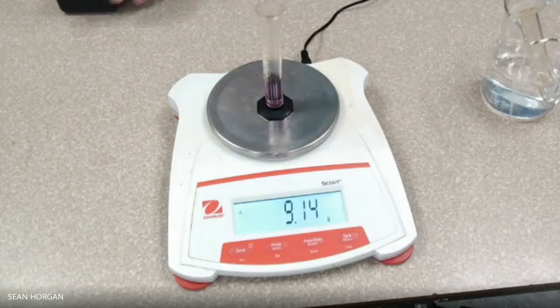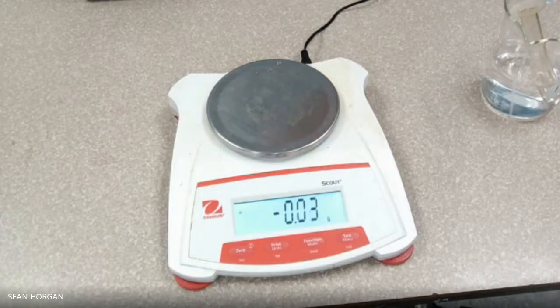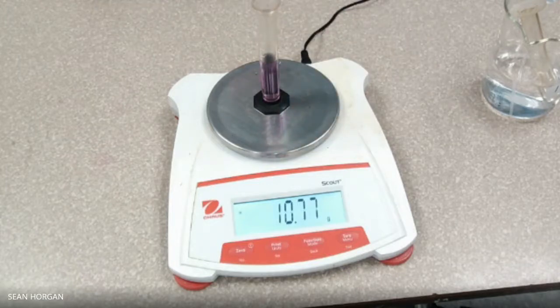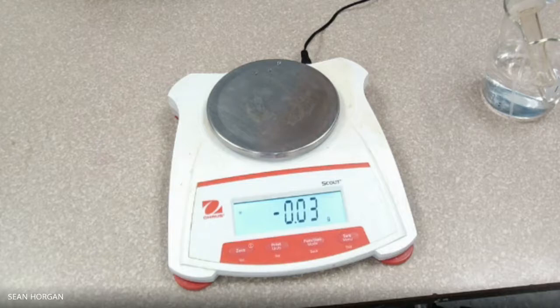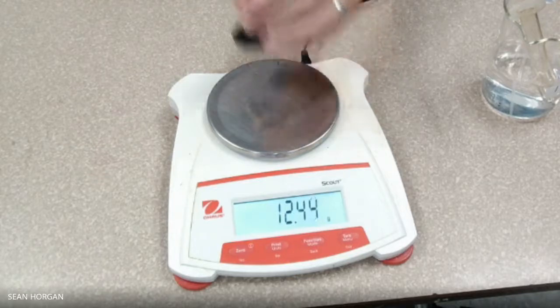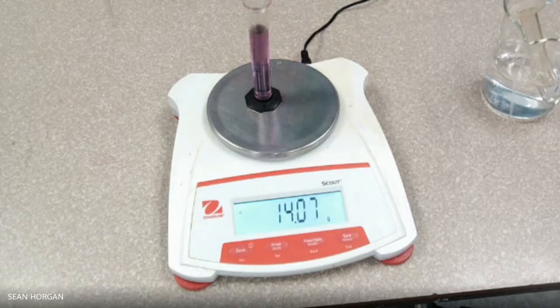Four milliliters of the unknown. Six milliliters of the unknown. And ten milliliters of the unknown. So now we have all of our data.